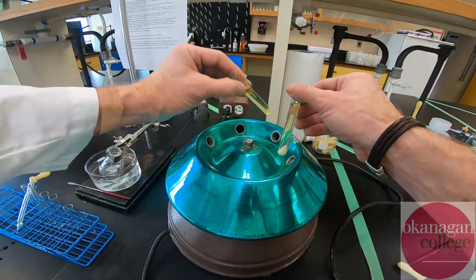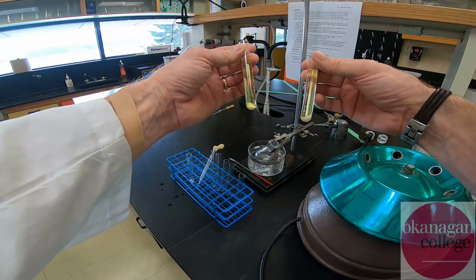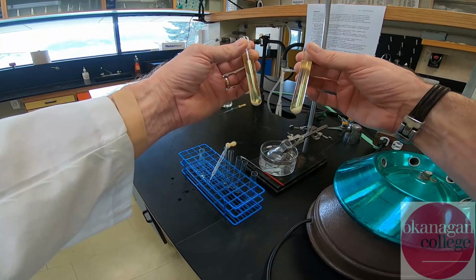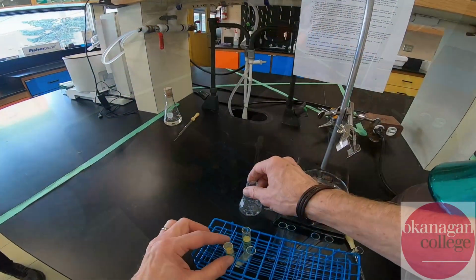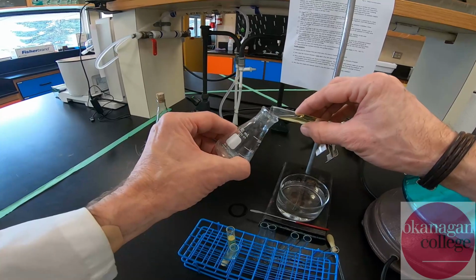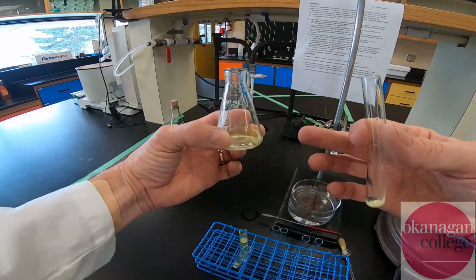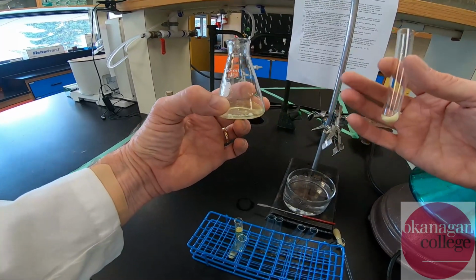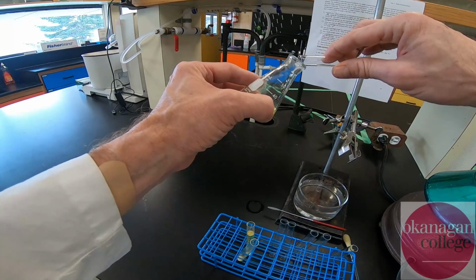There we have it, our isolated material. So all that remains to be done now is to remove the liquid above, isolate the solid, let it dry, and take a mass and melting point for yield calculations. So at this point, I'm just going to be pouring out the liquid from the centrifuge. You can see that the liquid is actually yellow in color, so we do know we're losing some material because of solubility. Some material has simply just dissolved and isn't coming out of solution.